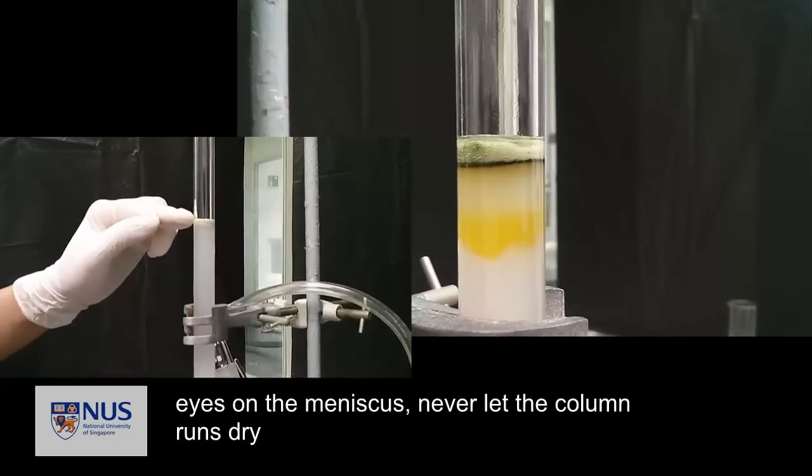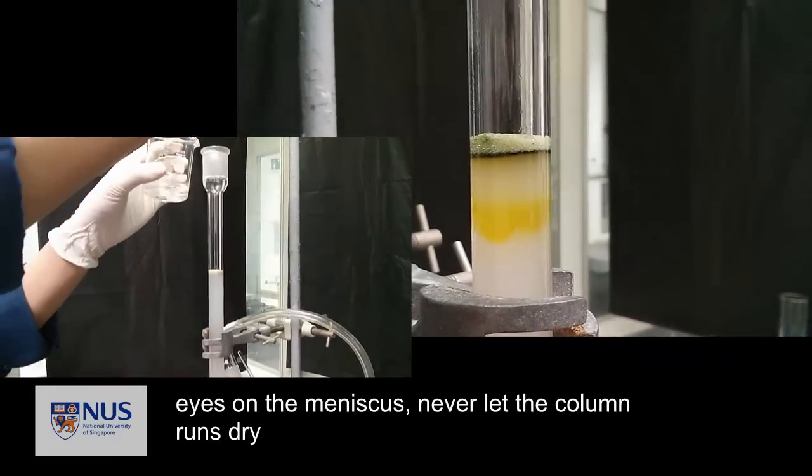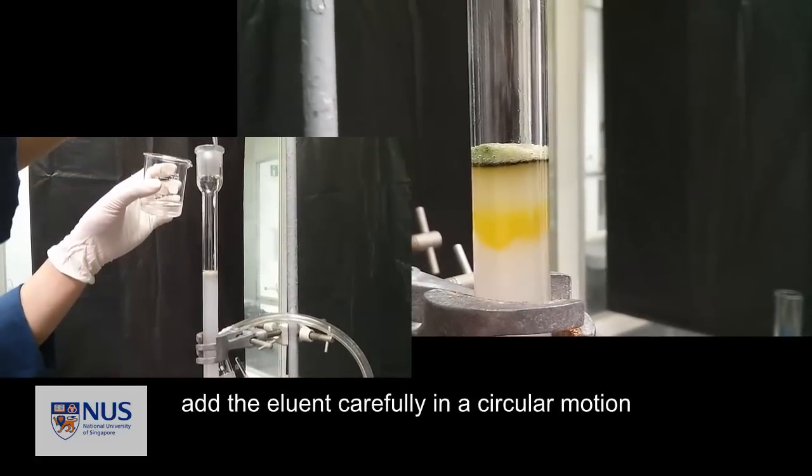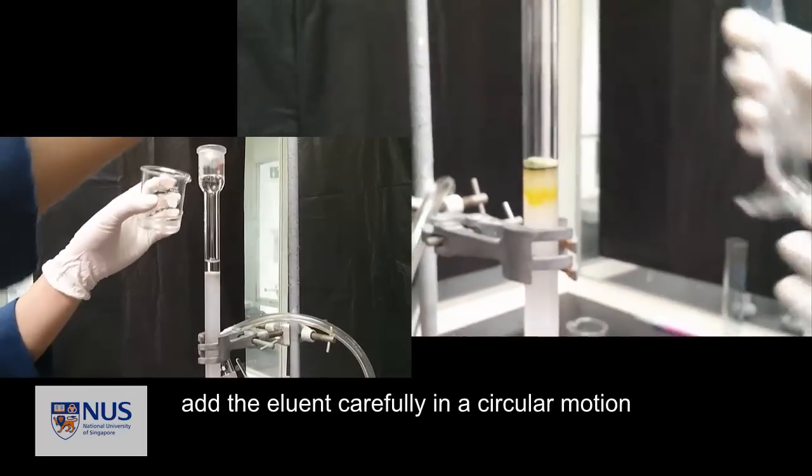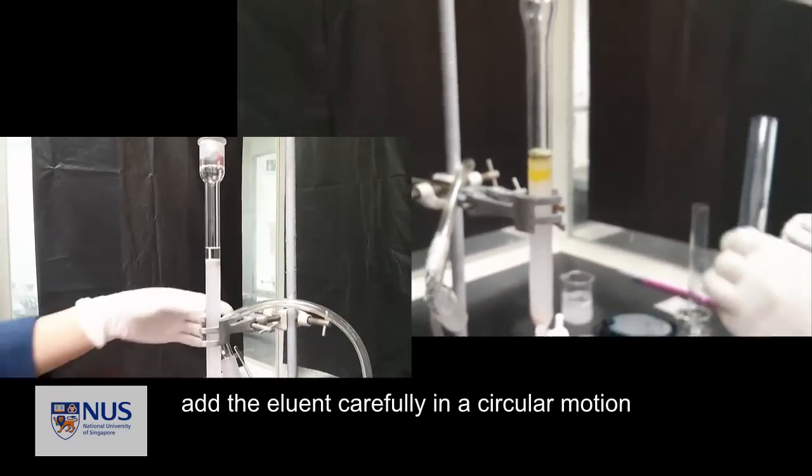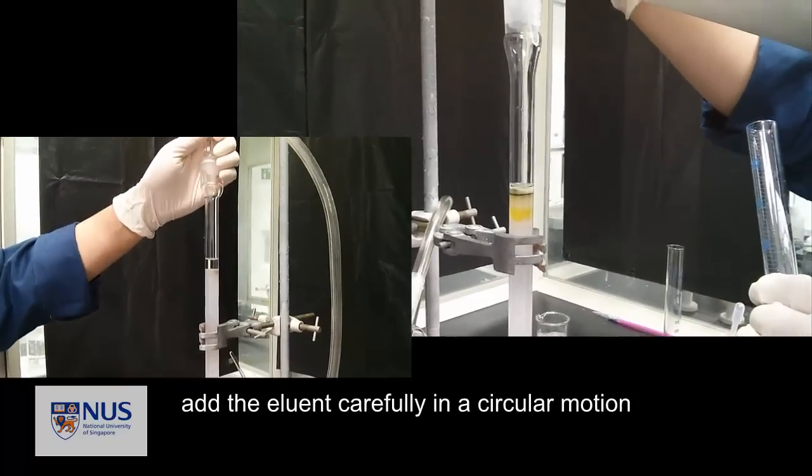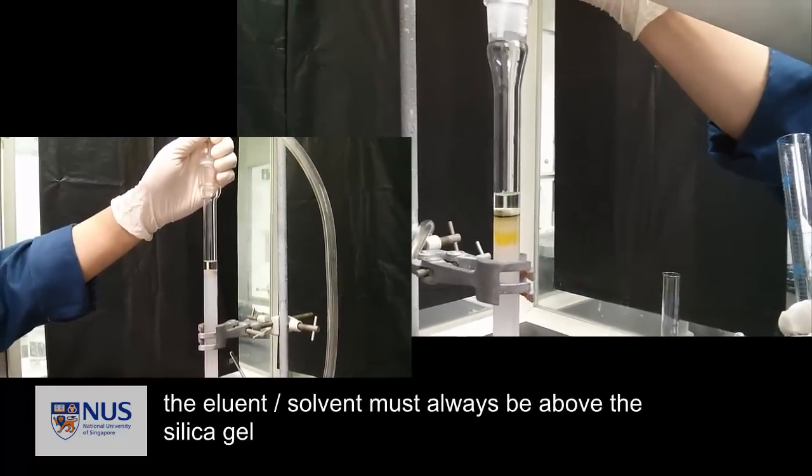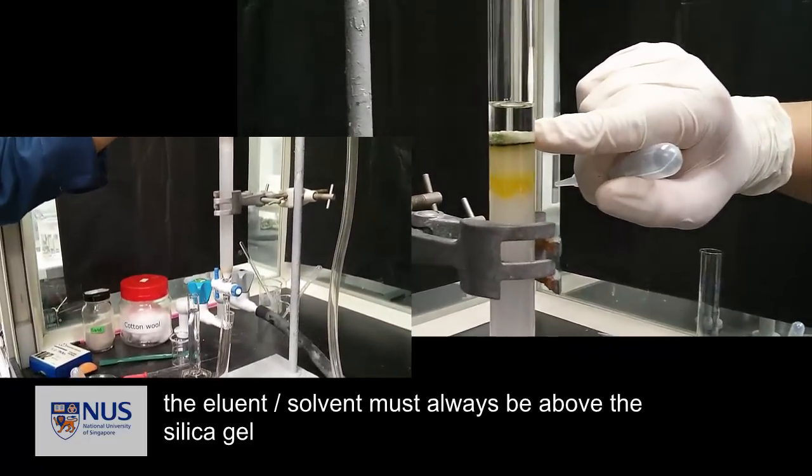Keep your eyes on the meniscus of the eluant and never let the column turn dry.